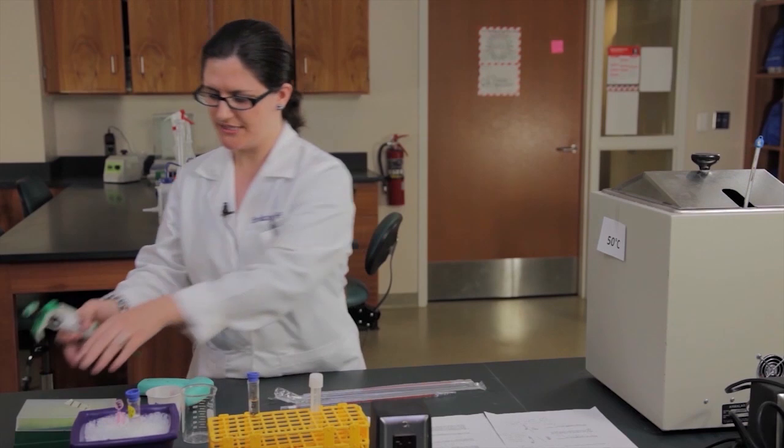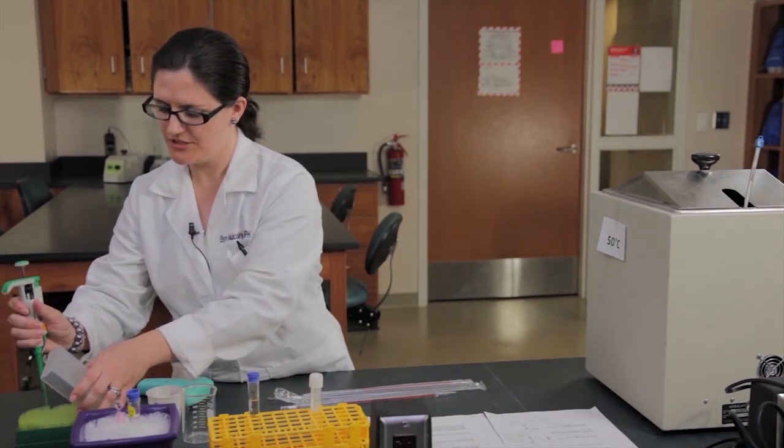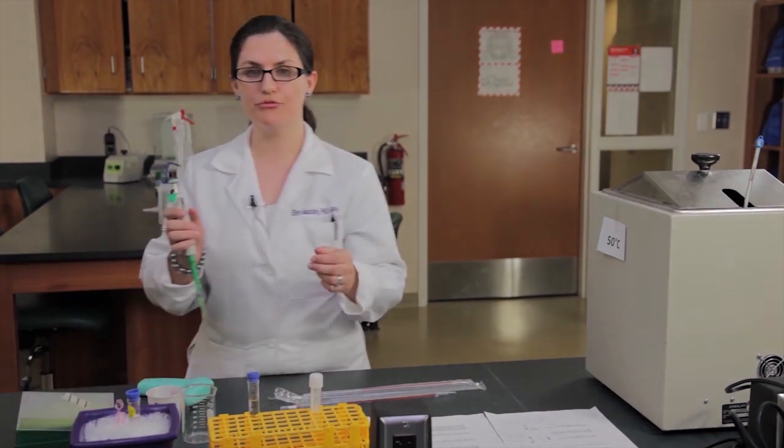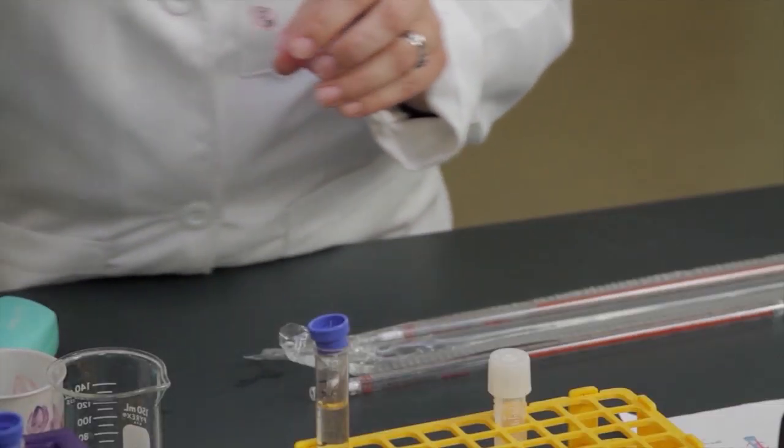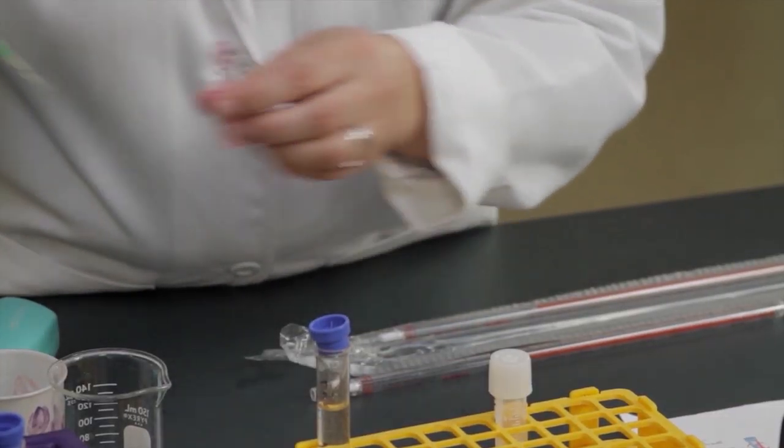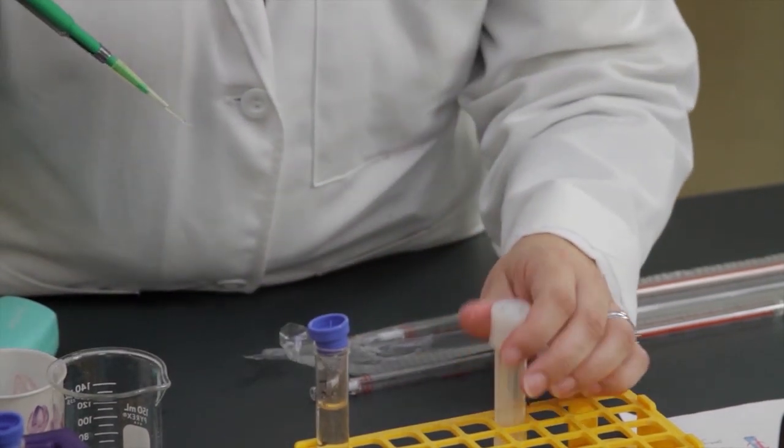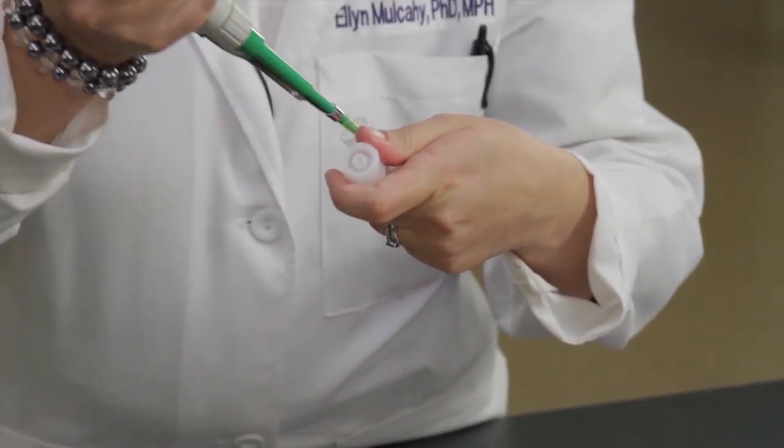The next thing we're going to do is we're going to add protease. Protease is an enzyme that breaks down protein, so that will start breaking down any large proteins that are still held together inside our solution. So I'm going to add 20 microliters of protease into my extraction.